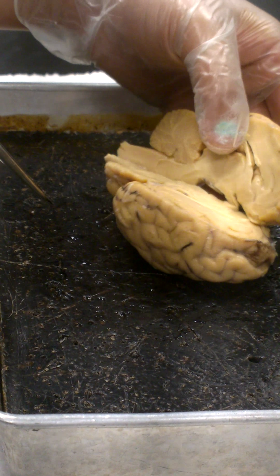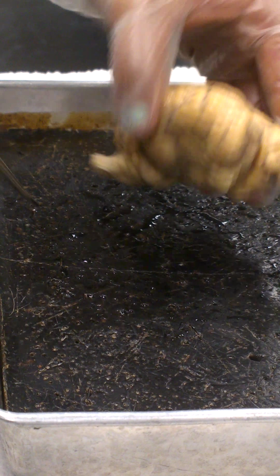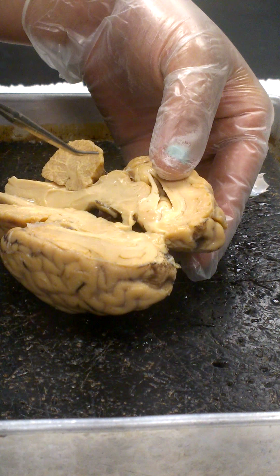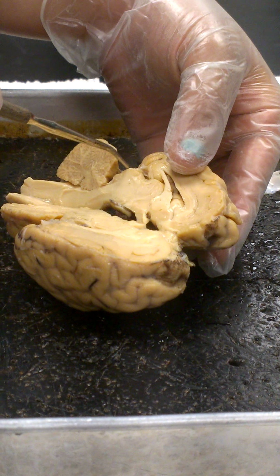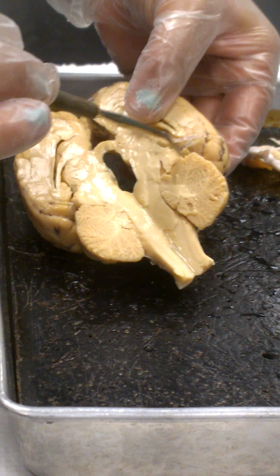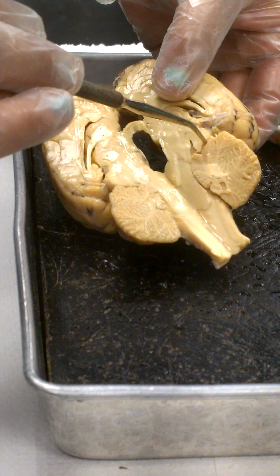The pineal body is quite a bit larger in a sheep than it is in a human relative to the proportional size of the brain. It's this other round structure right here. This is half of it. We've sliced through it by making a sagittal section. Pineal body. Corpora quadrigemina actually means four bodies.